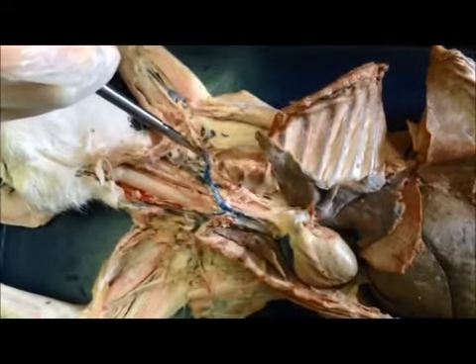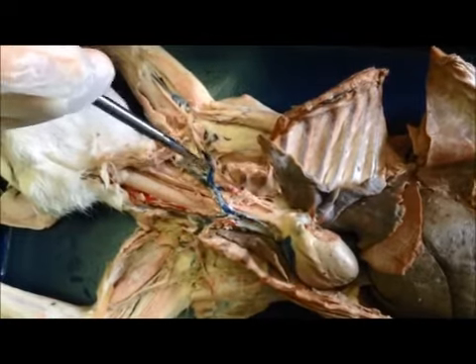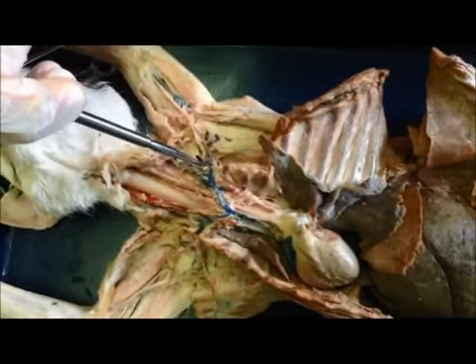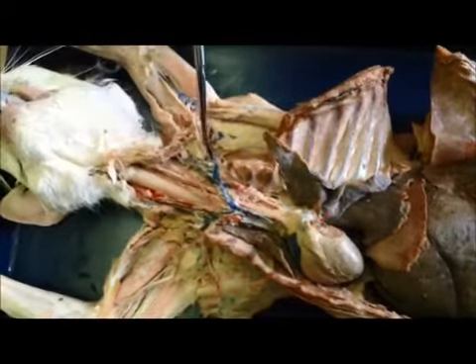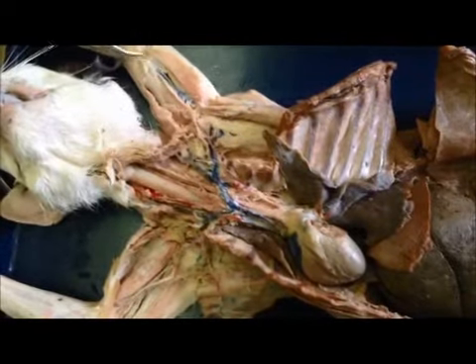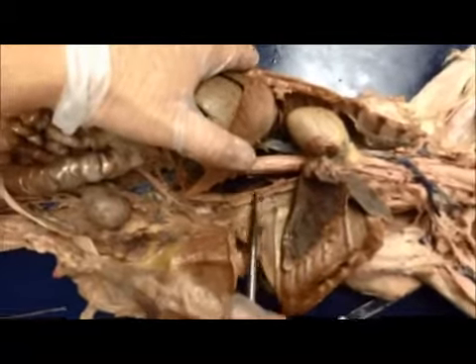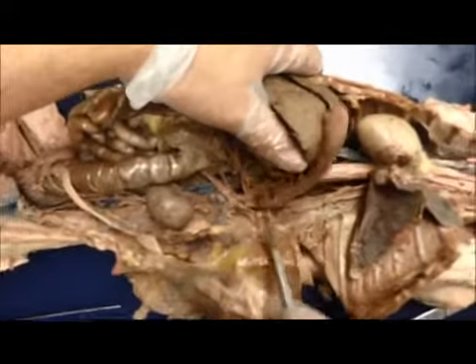This goes off to the subclavian. This is the left subclavian vein. After the left subclavian vein is the axillary vein. Goes down. Here's the subscapular vein, and going out towards the elbow is the brachial vein. We have the thoracic aorta coming down as it goes through the diaphragm, comes up.